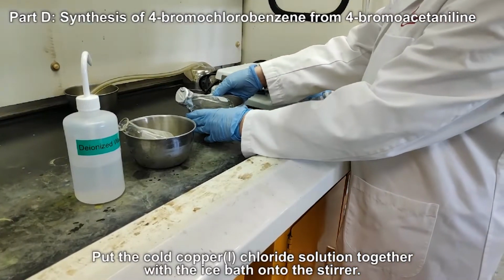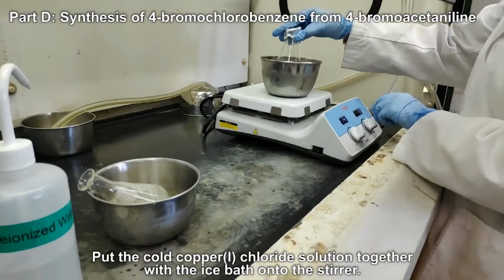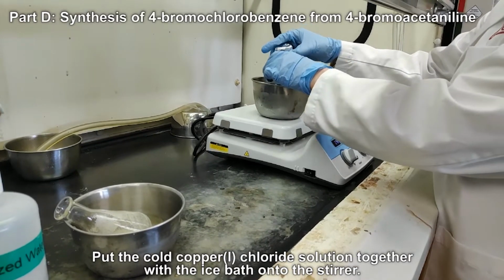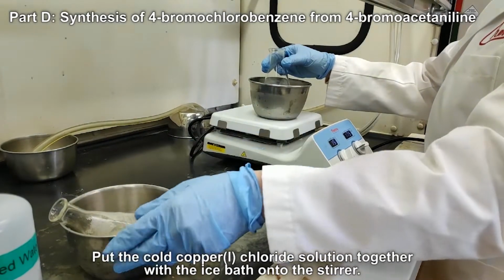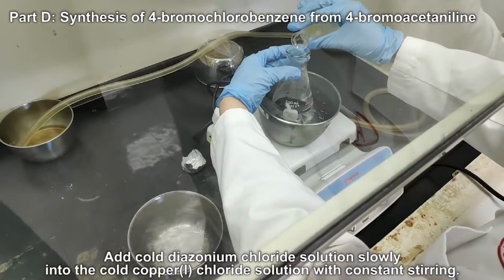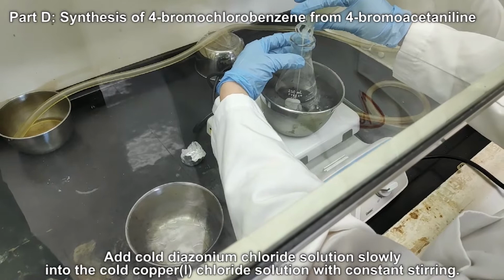Put the cold copper(I) chloride solution together with the ice bath onto the stirrer. Add cold diazonium chloride solution slowly into the cold copper(I) chloride solution with constant stirring.